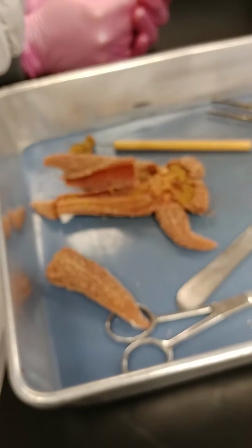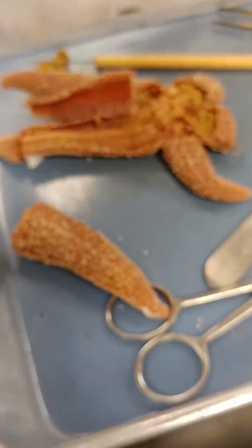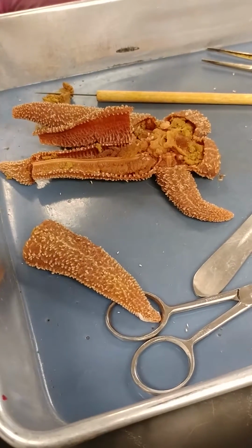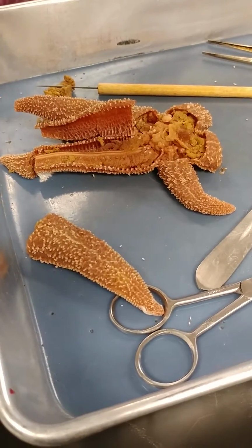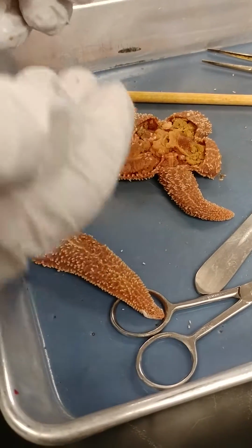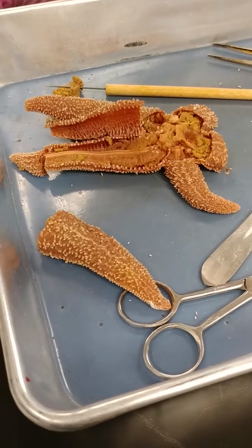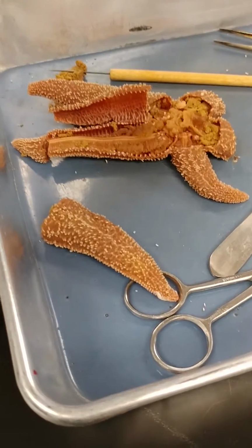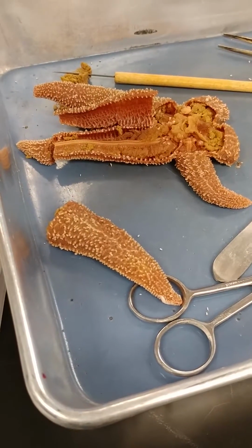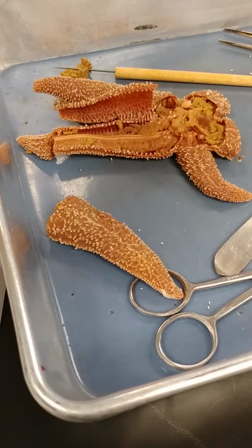Okay. So what's happening is if you push water into the tube feet, you can extend it out. And you can also flatten out that suction cup so it doesn't attach to the surface. Right? So if you pull water out, you're actually causing a suction by warping or bowing up that tube foot. So they're using water to move the tube feet, but also to have that suction action as well.